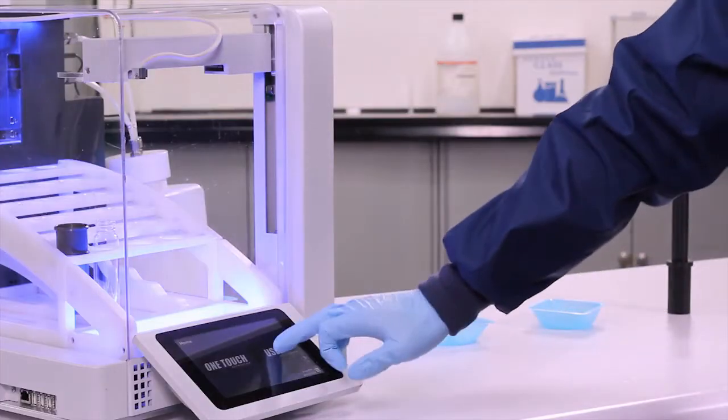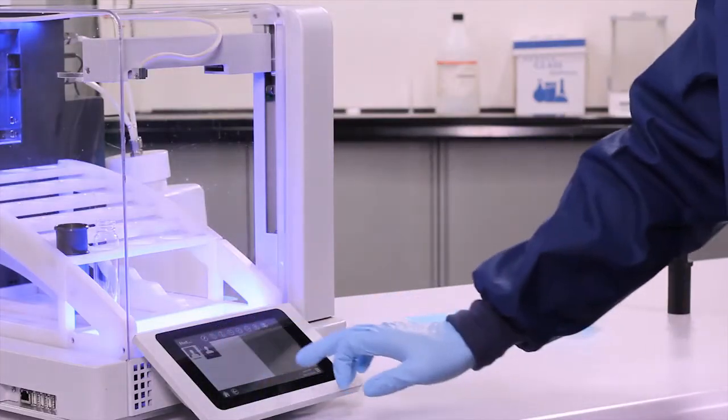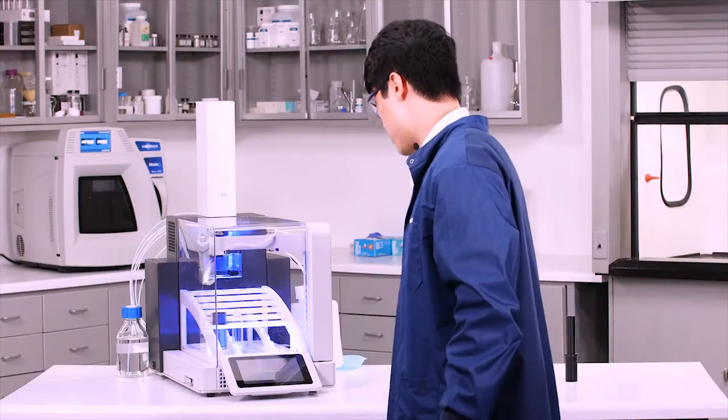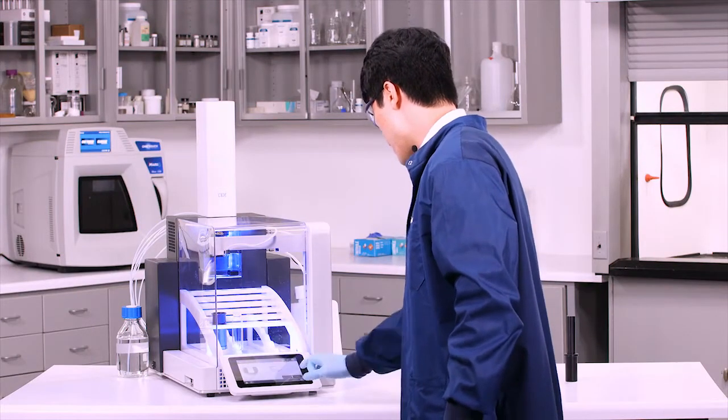I'm going to go ahead and load our method, press play, and press start.